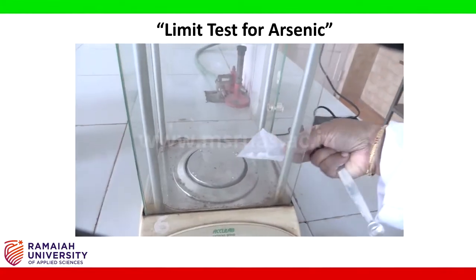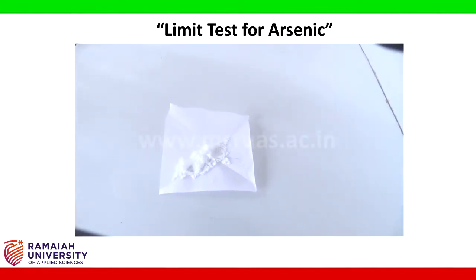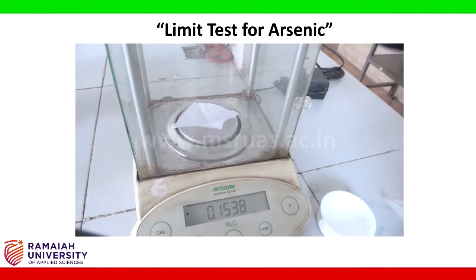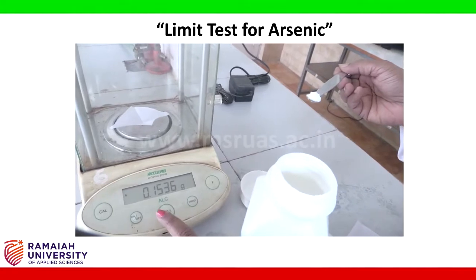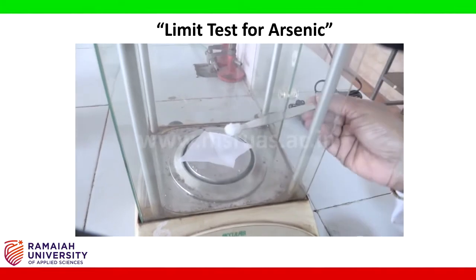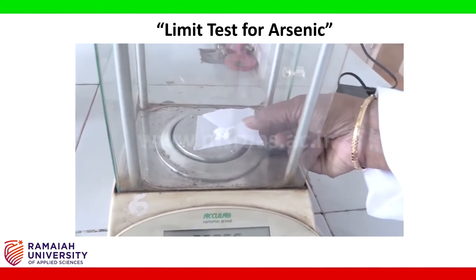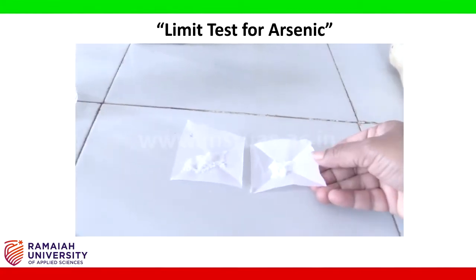One gram of potassium iodide for standard. Similarly, we'll weigh 1 gram of potassium iodide for sample also. One gram of potassium iodide for preparing the sample solution.